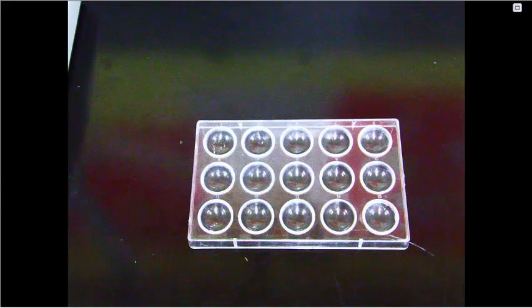This is the McMush Macromolecule Food Lab. The question which we are trying to answer is which macromolecules are present in the McMush food slurry? Our hypothesis is that if carbohydrates, proteins, and lipids are present in the food slurry, then each of these will test positive in the presence of their respective reagents.